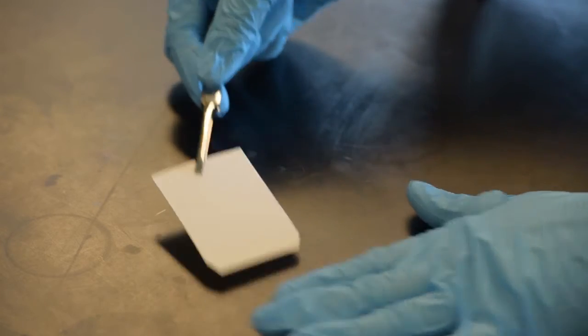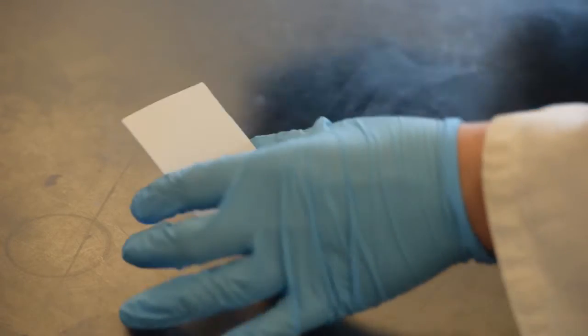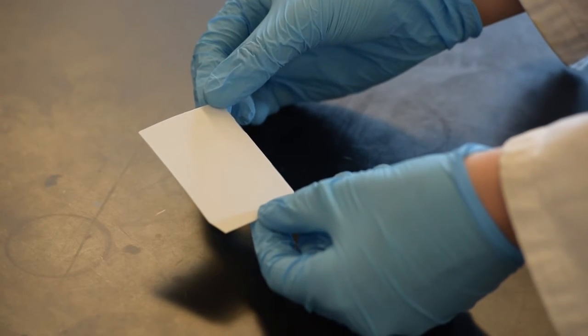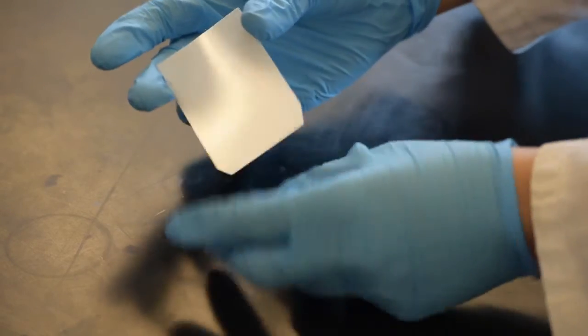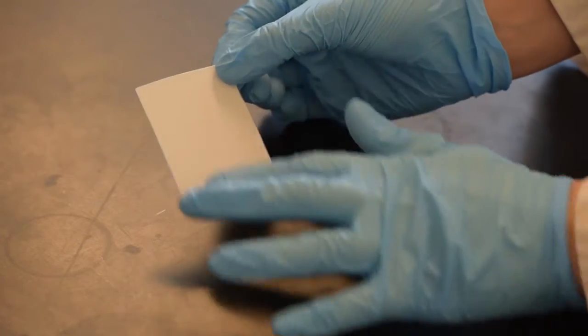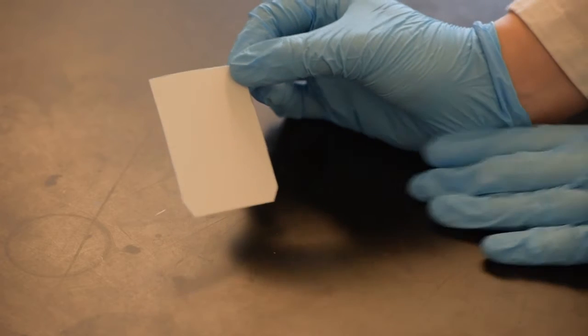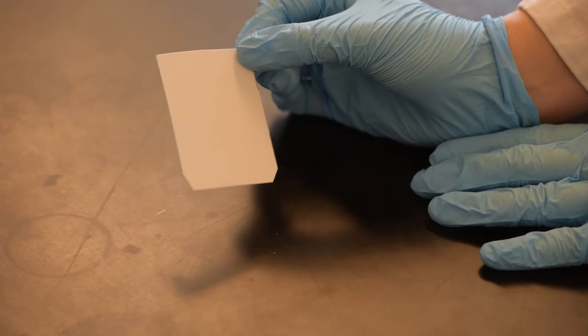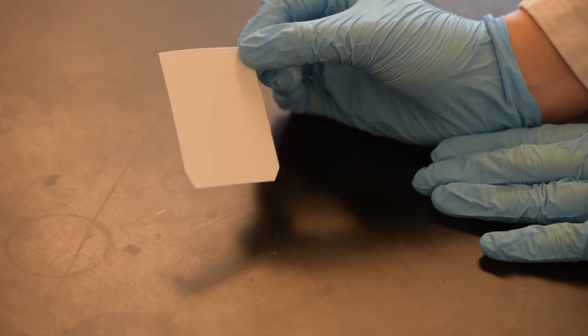The stationary phase will be a thin layer of silica gel fused onto a plastic plate. This is your TLC plate and should always be handled by tweezers or gloves. There are two sides to the TLC plate, the smooth, clear-looking side and the rougher solid white side. The solid white side is the side with the silica gel, so that will be the side to which you will load your samples. The TLC plate is likely already going to be cut for you.